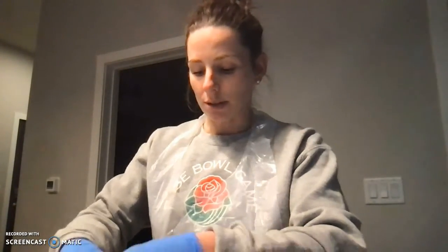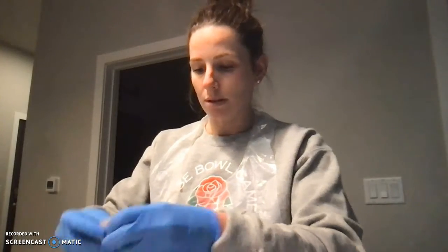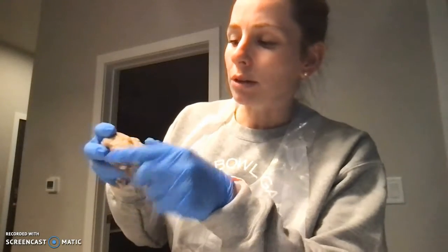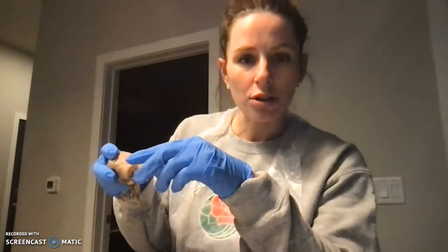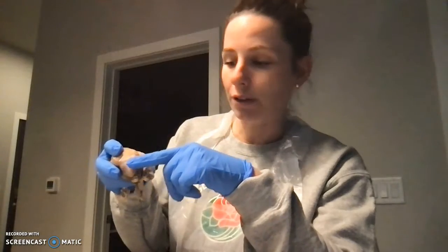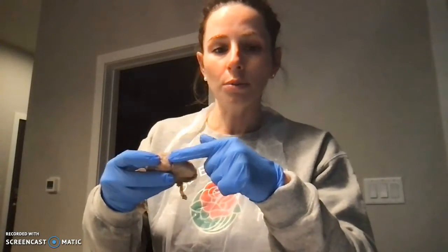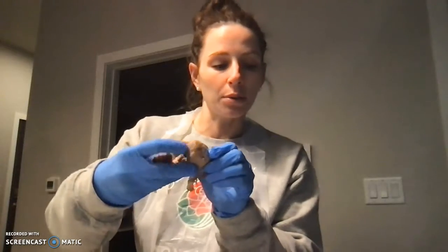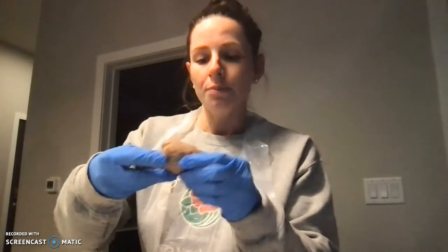All right, so I'm going to start here by talking about the different lobes. So we have our brain here. And the lobes of the brain are also matched with the bones of the skull. So you have your frontal lobe here in the front, your parietal lobe here on the side with the temporal lobe down below, and the occipital lobe on the back.